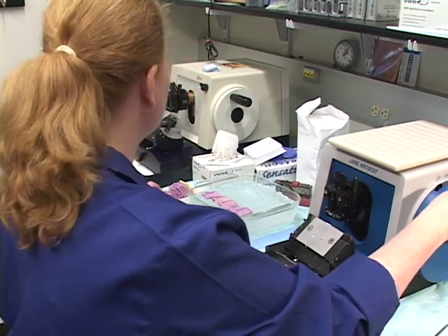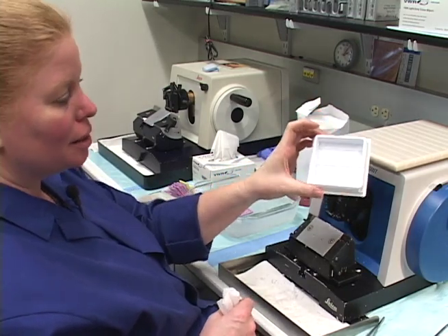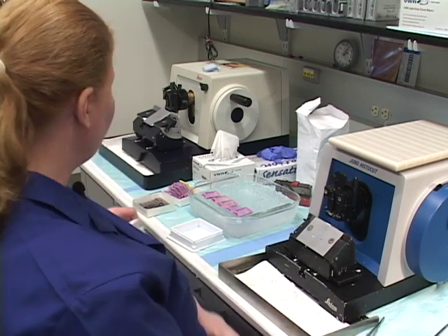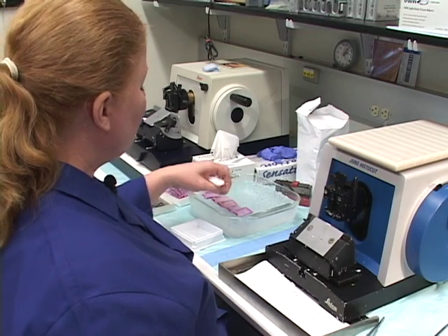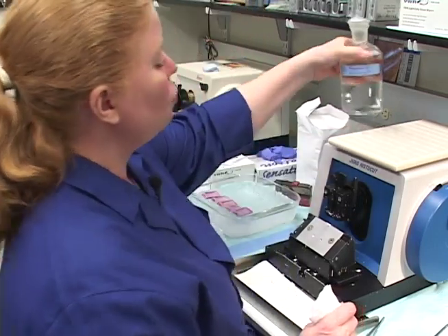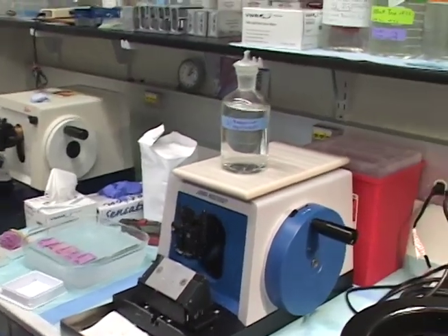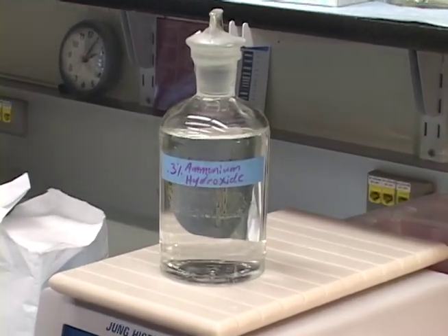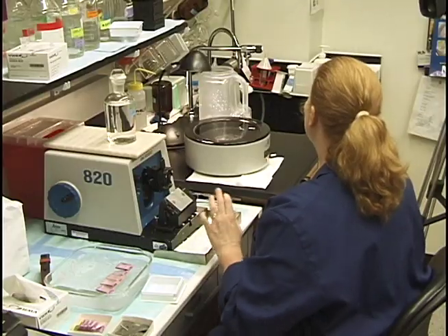You can start with room temperature water — I keep these slide bottoms from the charge slides just for that purpose. If that's not quite working, you can use a 3% ammonium hydroxide solution for soaking. Be careful with it — it should only take about a minute, up to five minutes at most, and you want to keep checking your block face to make sure it's not getting over-soaked.